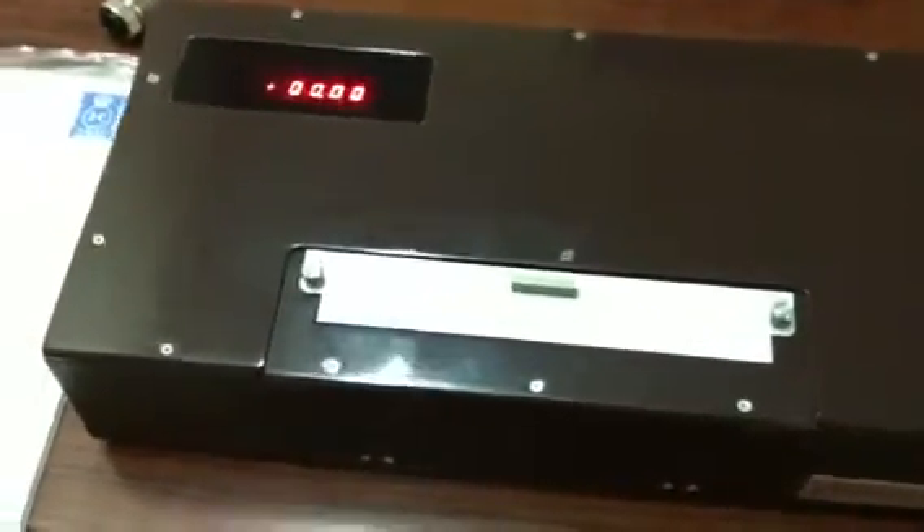Right now we are looking at a AA-10 digital polarimeter with a sugar scale installed in it. It is one of the most simplest units to be used — it has a zero reset button, a power input, and a turn on and off button. That's pretty much it.